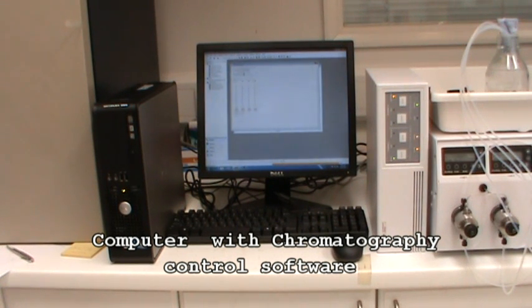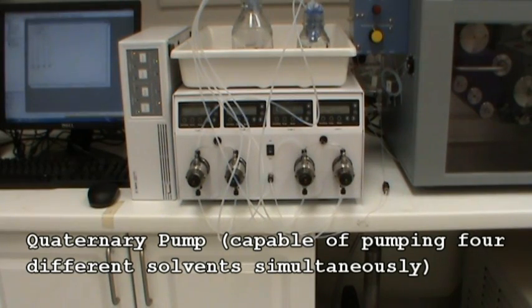First you'll need a computer with chromatography software installed on it. Then you'll need a suitable pump to deliver the solvent. In this case we have a quaternary pump to deliver four solvents independently.